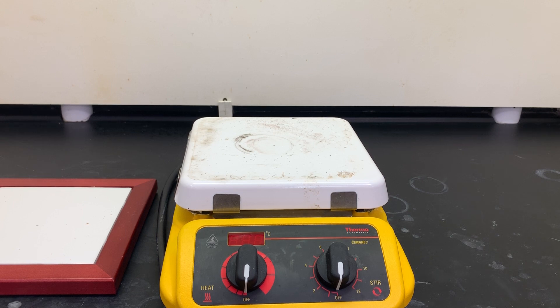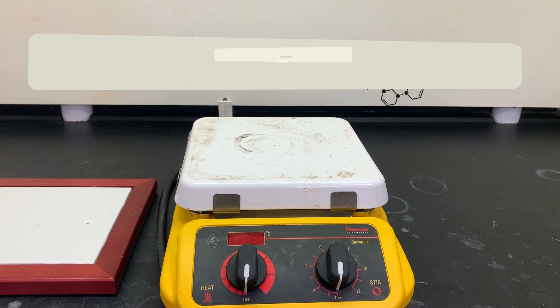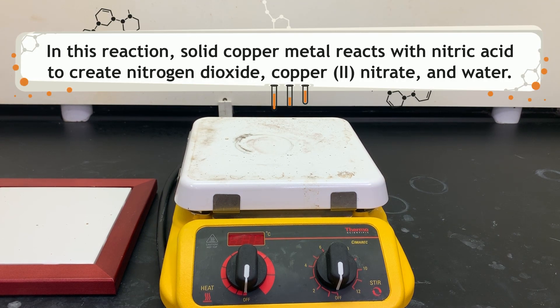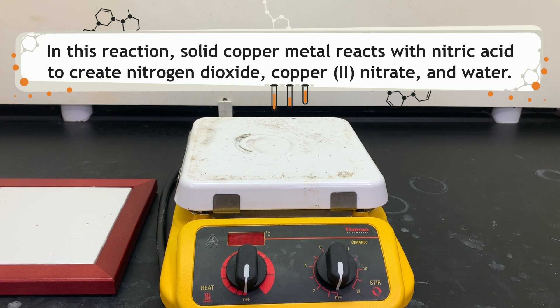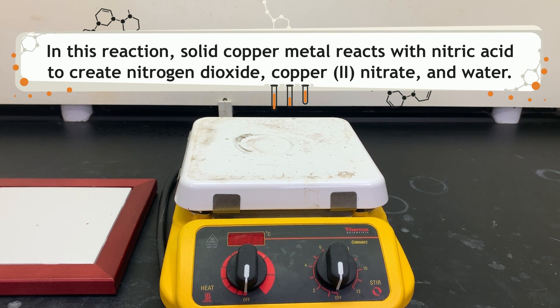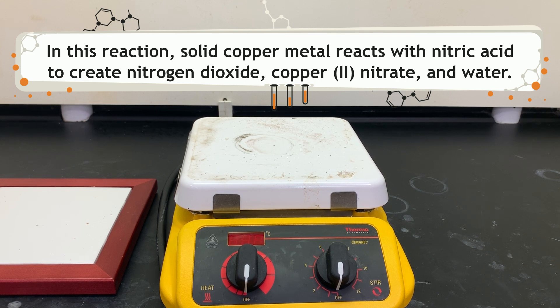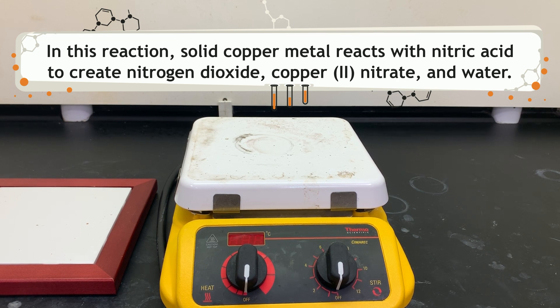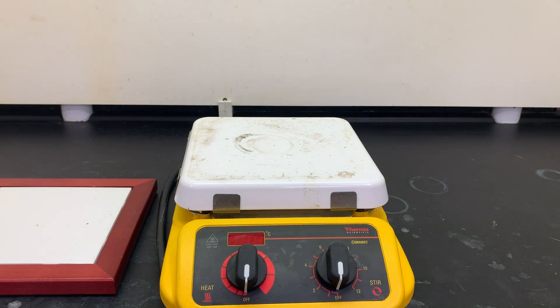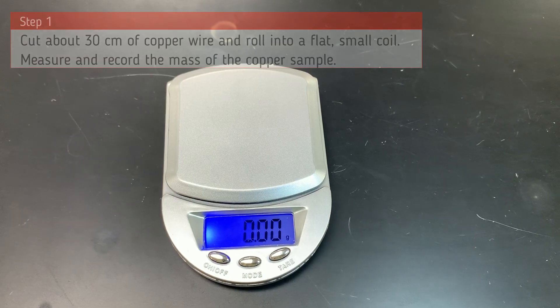This video will show reaction number one. In this reaction, solid copper metal will react with nitric acid to create nitrogen dioxide, copper 2 nitrate, and water.